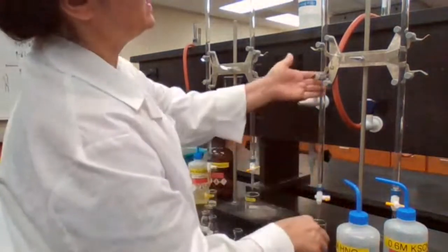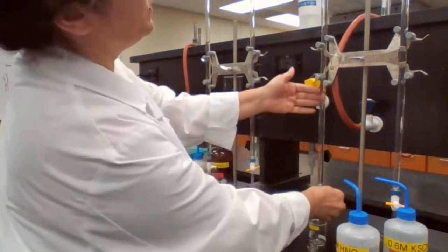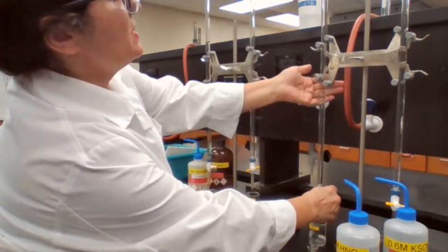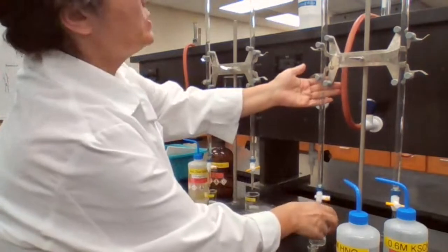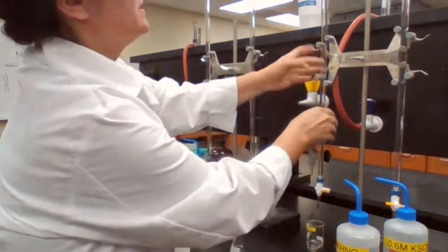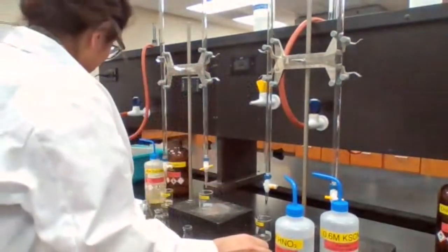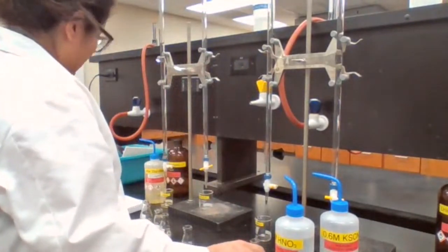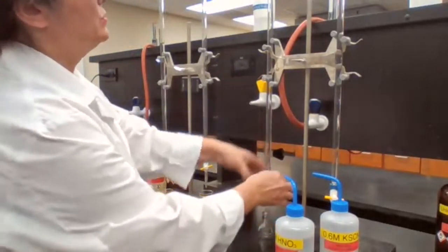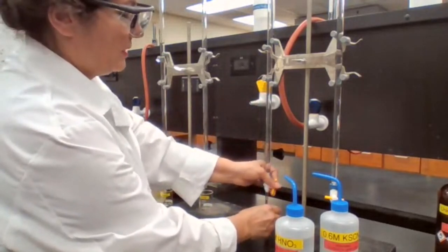When you add nitric acid and you have iron, that iron could be Fe2+ or Fe3+. What nitric acid does is convert all the iron to Fe3+. So when you are measuring, you are measuring iron three plus. You want to make sure all the iron is in the Fe3+ format. I'm going from the 29 to 34 mL mark to add the five milliliters.